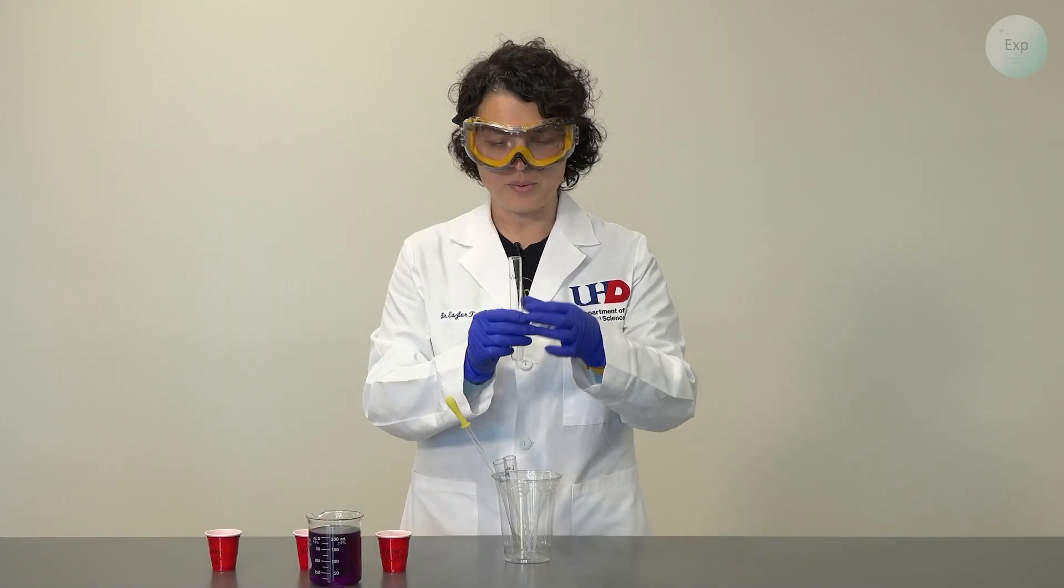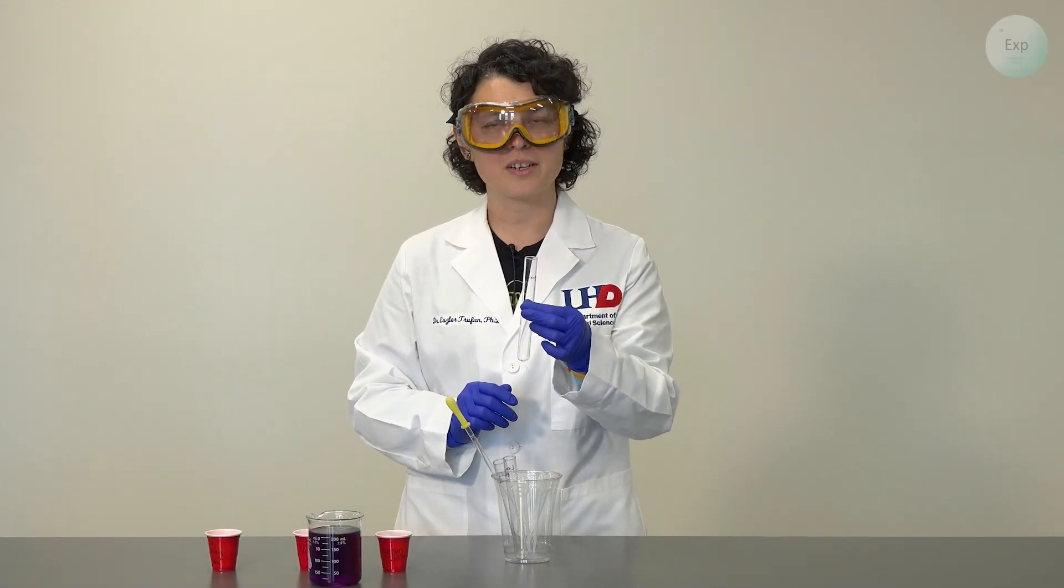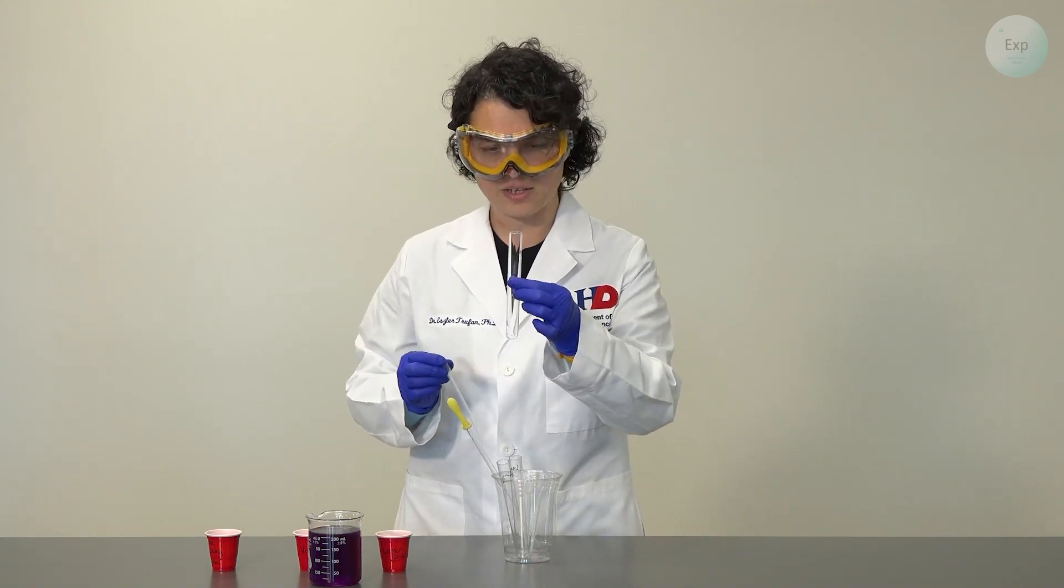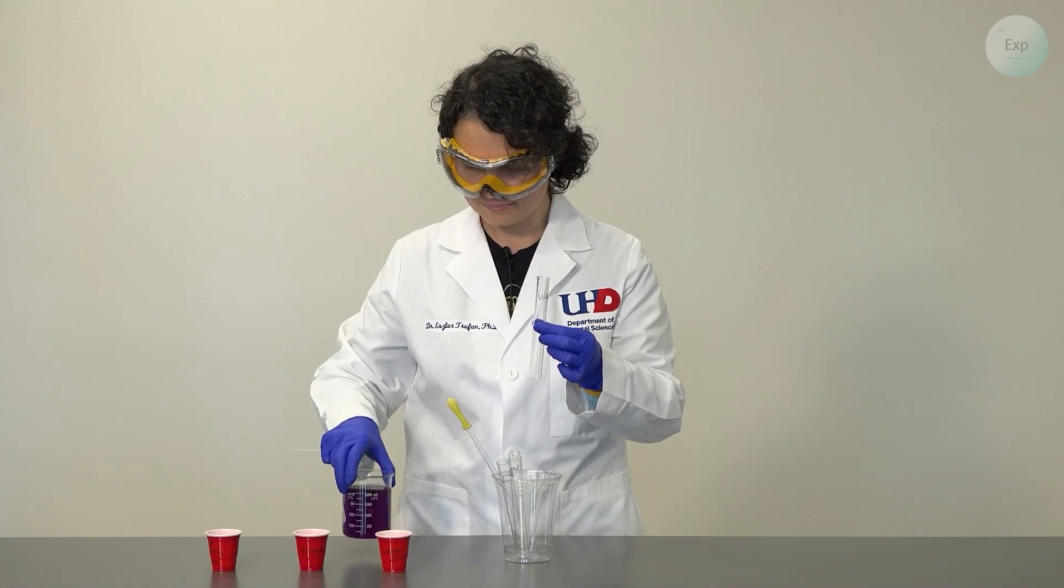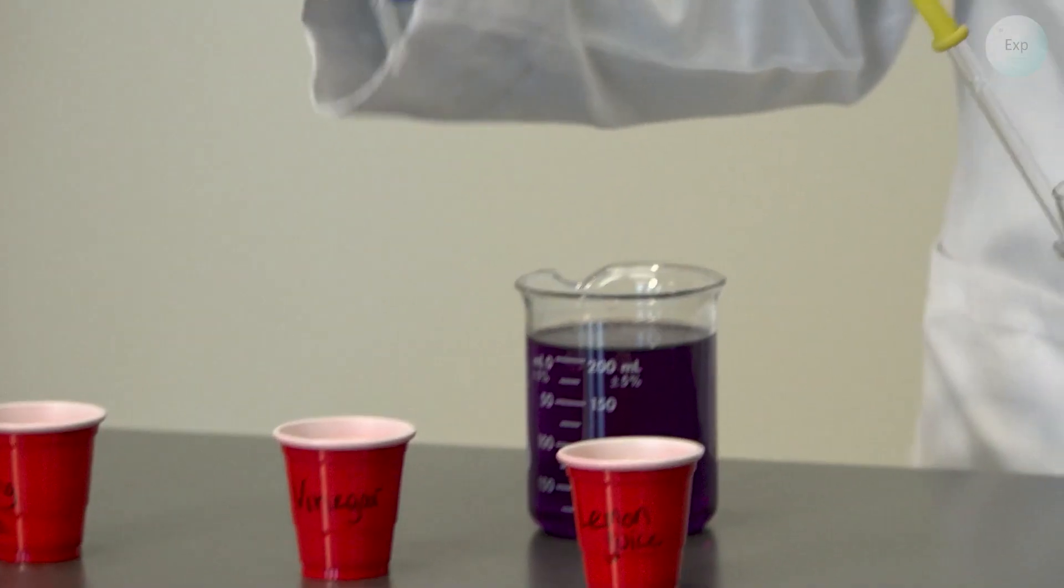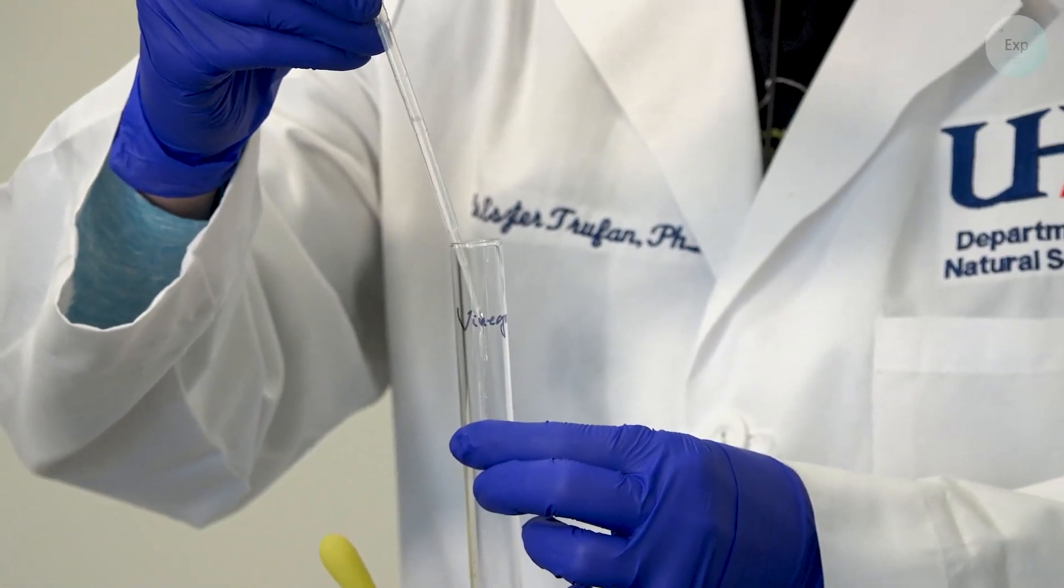I labeled all my test tubes to make sure that I don't accidentally confuse things. For the first one I have it labeled as vinegar. I will draw up some vinegar and transfer it into the test tube.